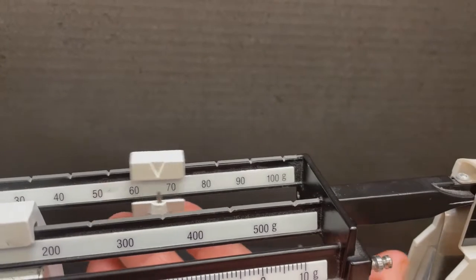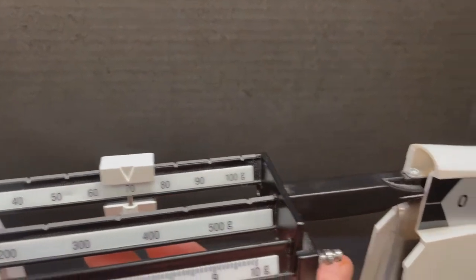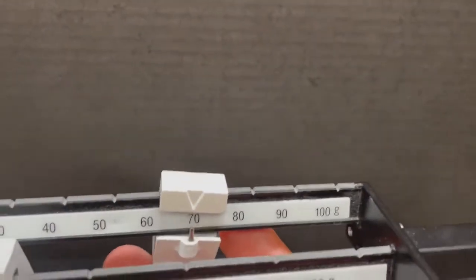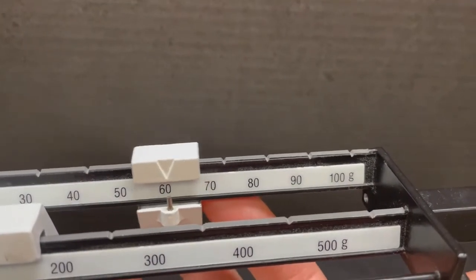It's still not moving, so let's take it up to 70. That's a little too much because that pointer is going below the zero. Let's take it to 60.